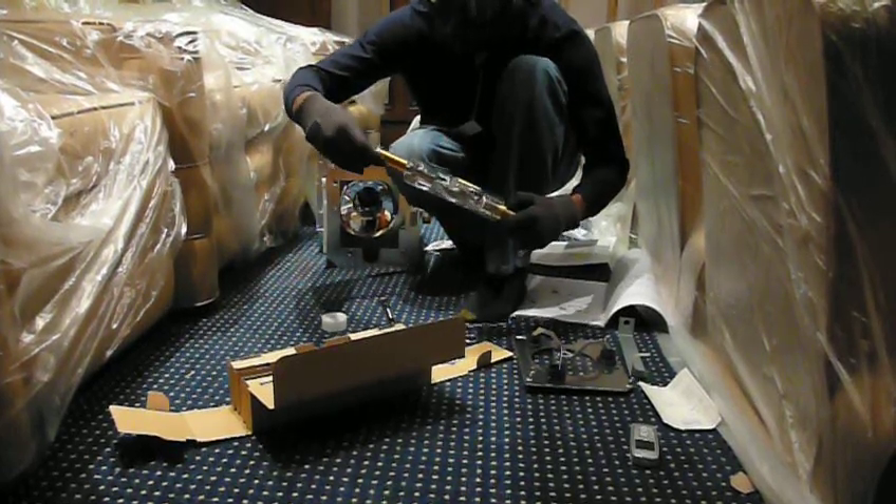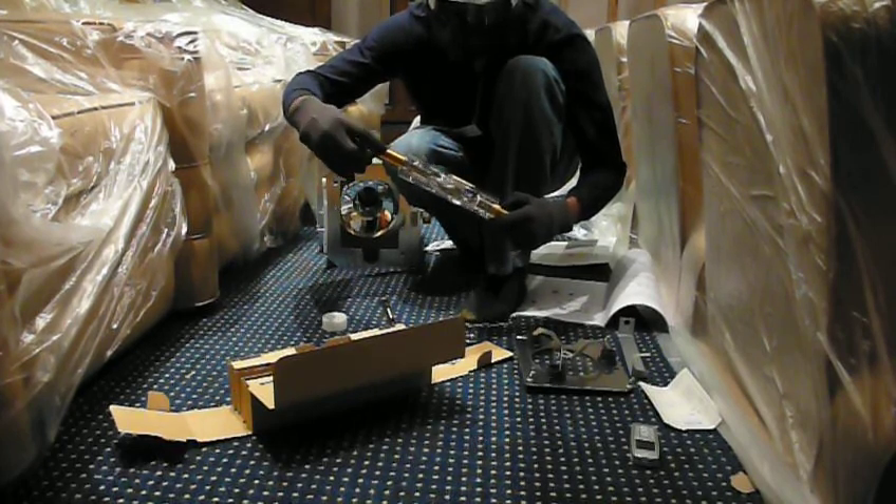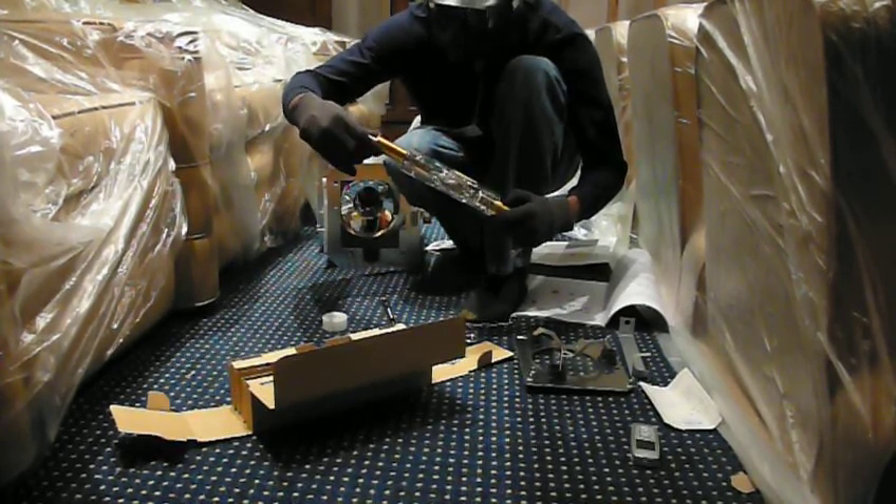I'll put it on. You see, it's nice to hold it up at the rear end of the lamp. And it screws on? Is that it? Yes, it screws on.